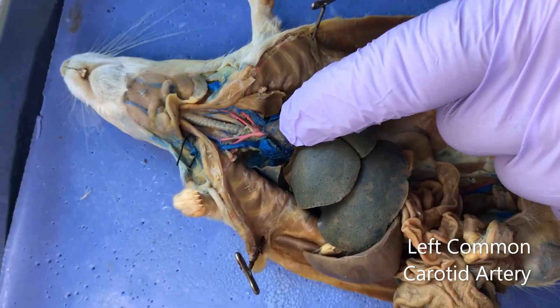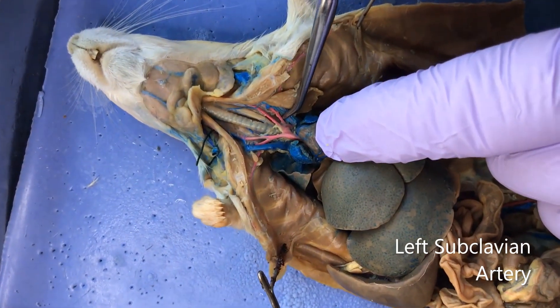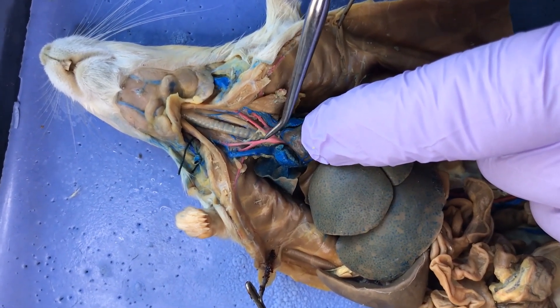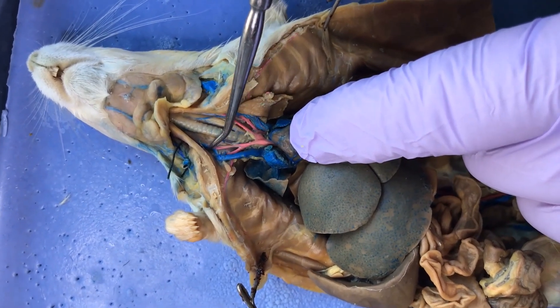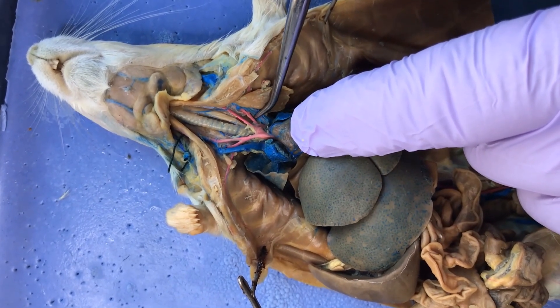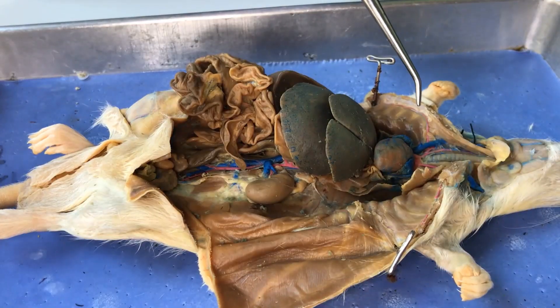The second blood vessel that branches off of the aortic arch is the left common carotid, which exits by itself, as does the left subclavian artery. So there are three things emerging from the aortic arch: the brachiocephalic trunk, which bifurcates into the right common carotid and the right subclavian, then the left common carotid, and the left subclavian.